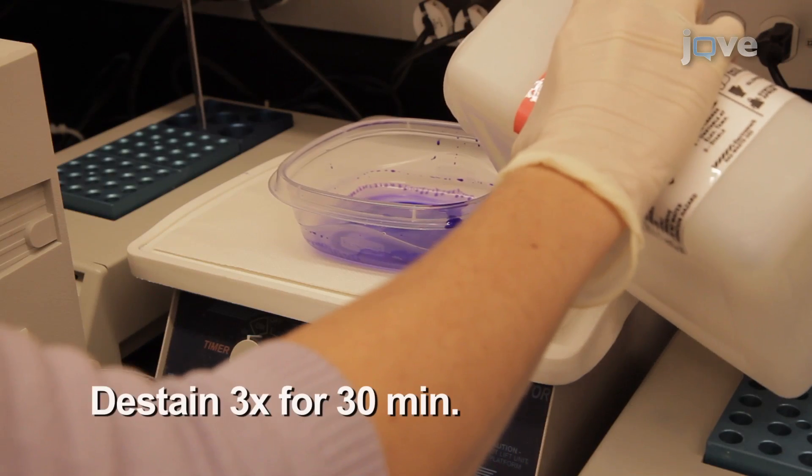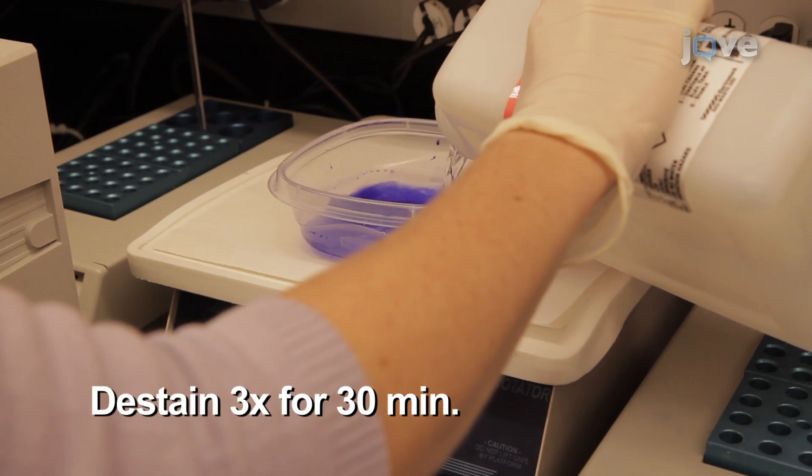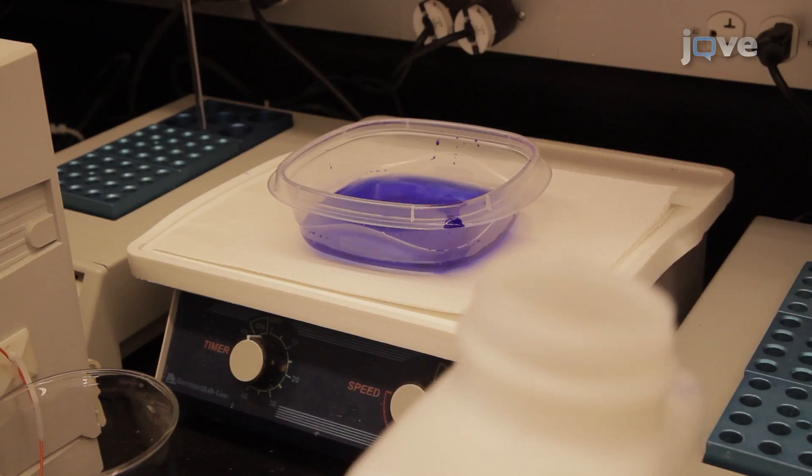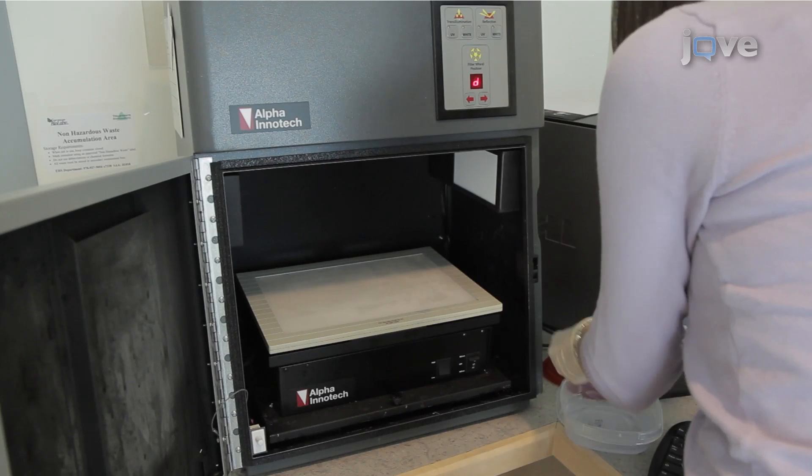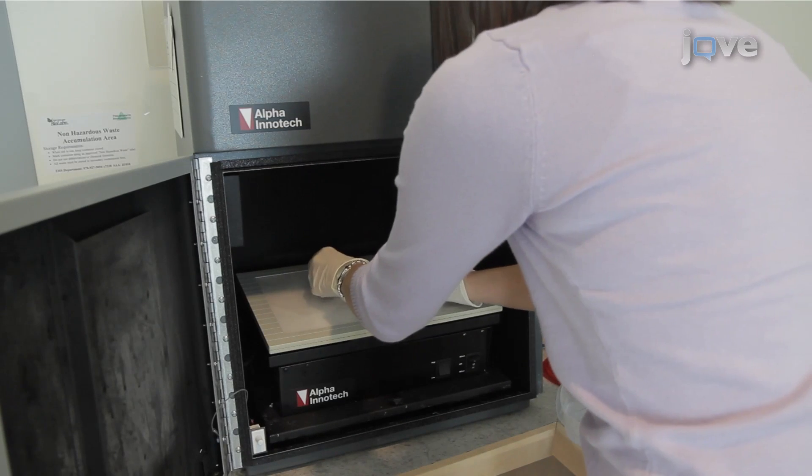After the gel is stained, wash 3 times for 30 minutes in 50 milliliters of de-stain solution. Record the images using a white light transilluminator or scanner.